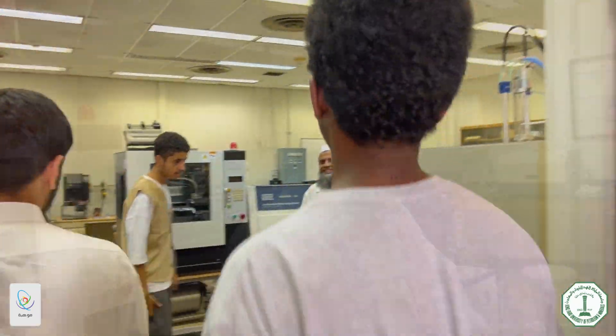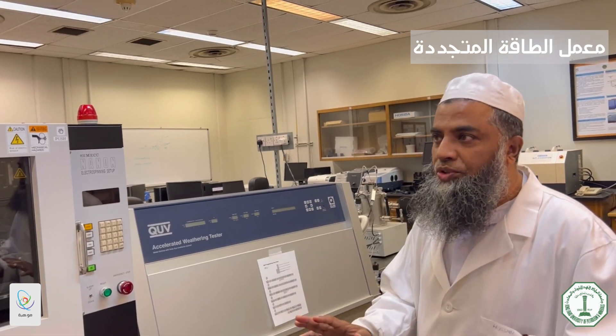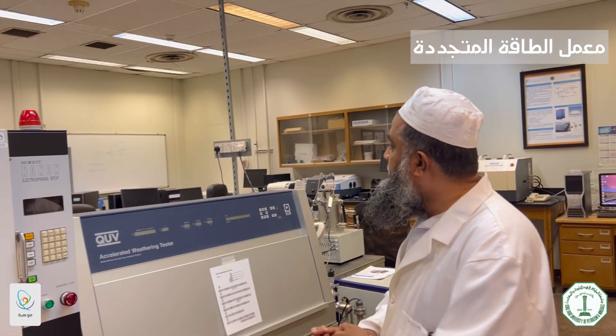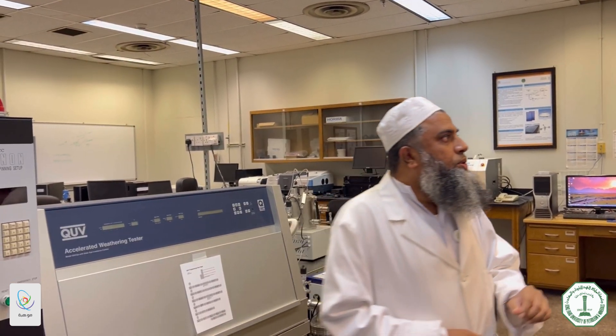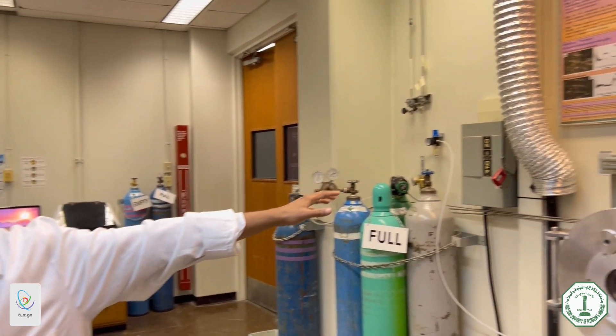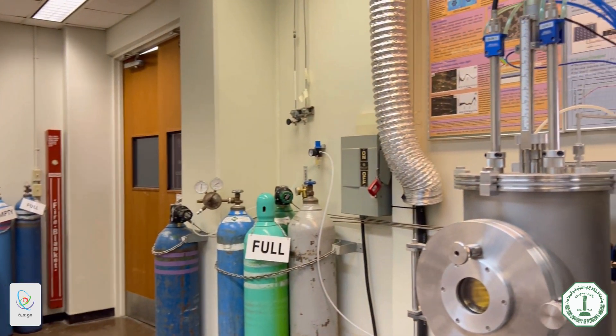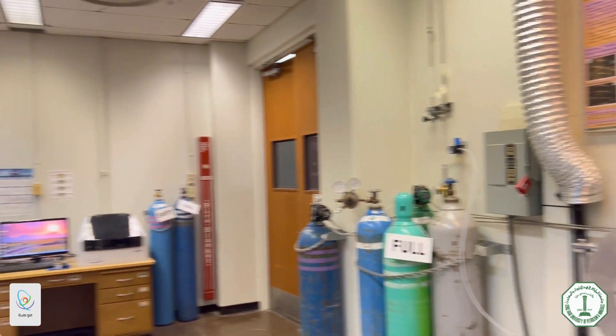In this lab, we have four fabrication tools and there are seven or eight characterization tools. What we do here — for solar cells, or light-emitting diodes, or some opto-electronic devices — we need to characterize them.